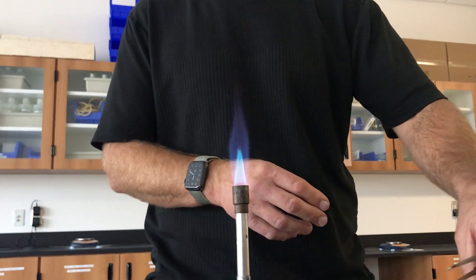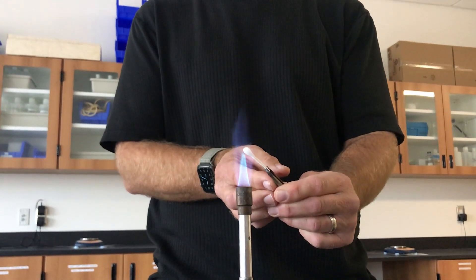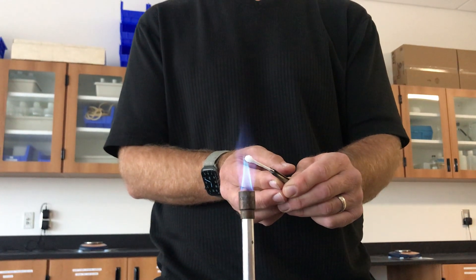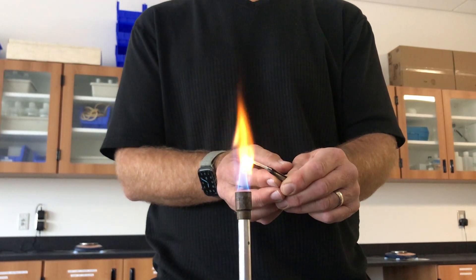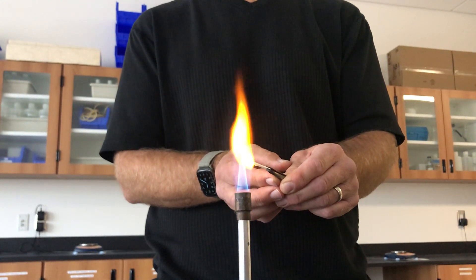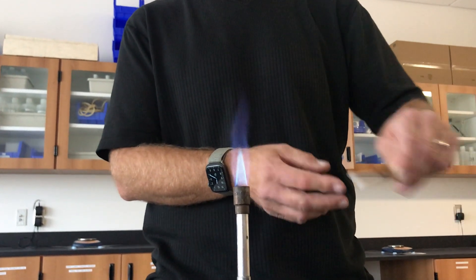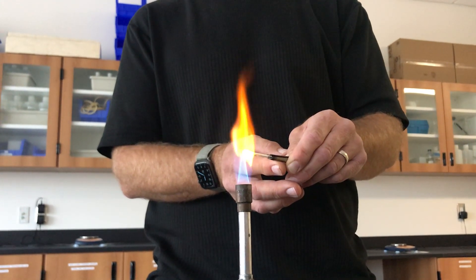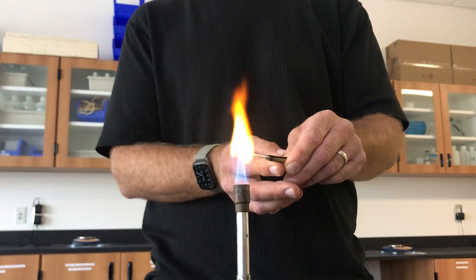Now let's go back and do unknown C. Here we go. And that's a great result for unknown C. Maybe give you a little bit more of that one. There's your unknown C.